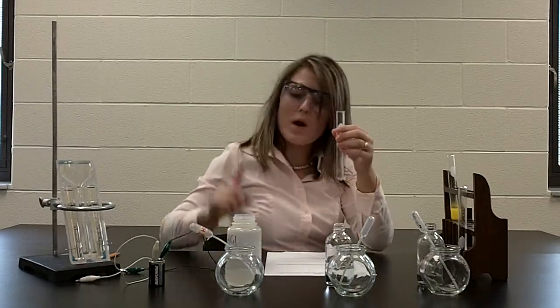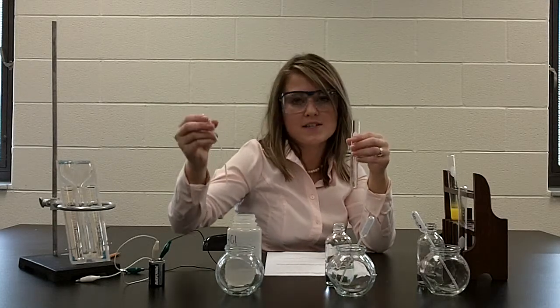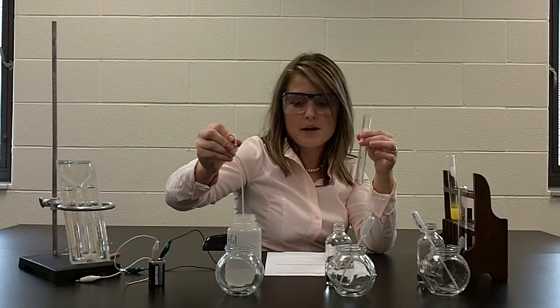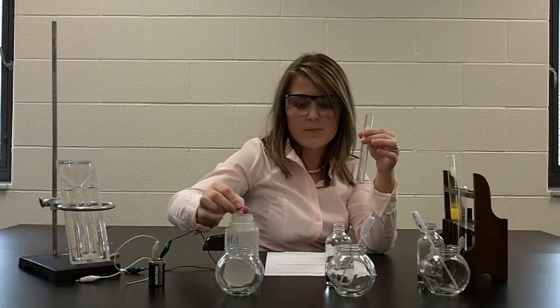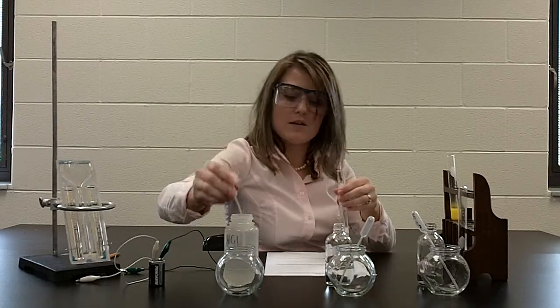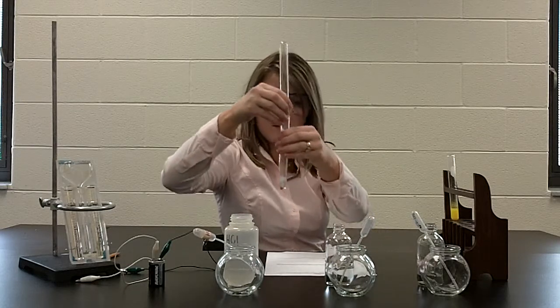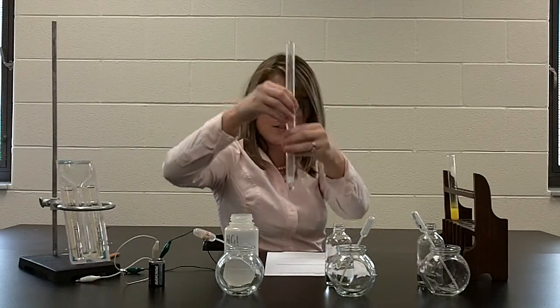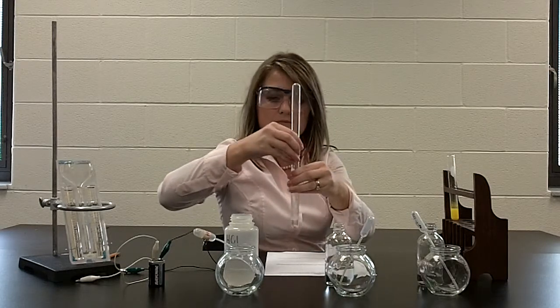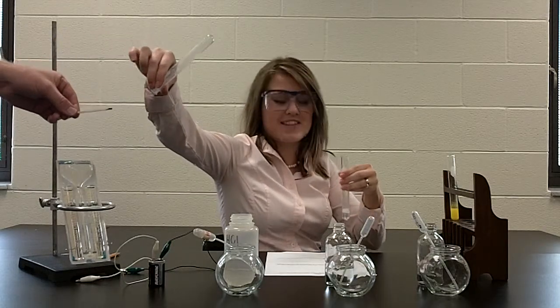Then you're adding 1 pipette full of 3 molar hydrochloric acid. So this is a strong acid being added to a metal. Again, you're squeezing your pipette out above the solution. You draw up the solution until the bulb is full. Then you add it. And very quickly you need to grab a new test tube and seal in the gas that's being formed, as you can see with the bubbles. And then Part 4, you're lighting a wood splint, and you add it to the gas, and you get that sound.